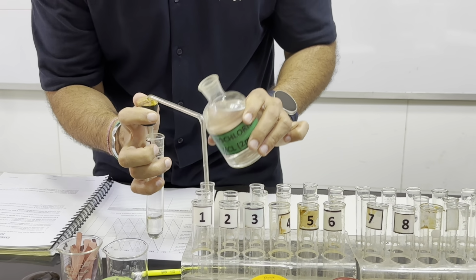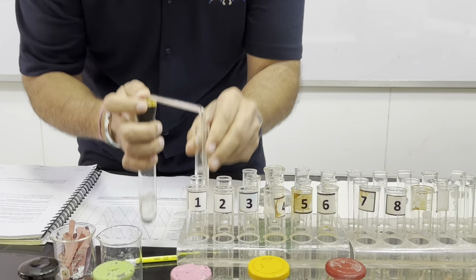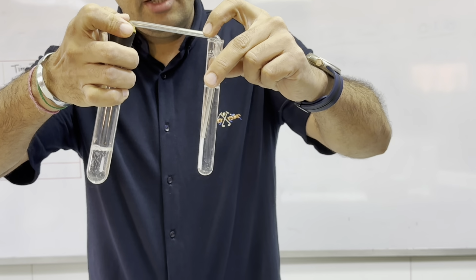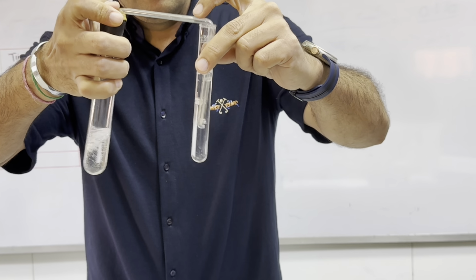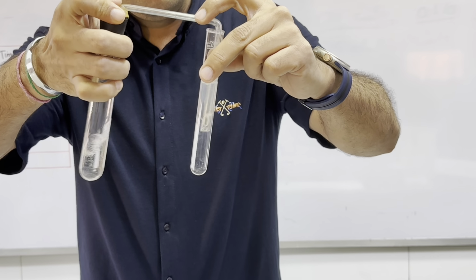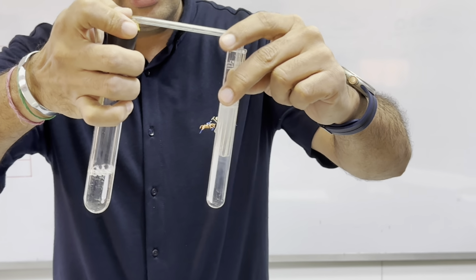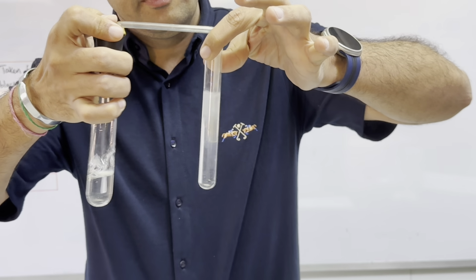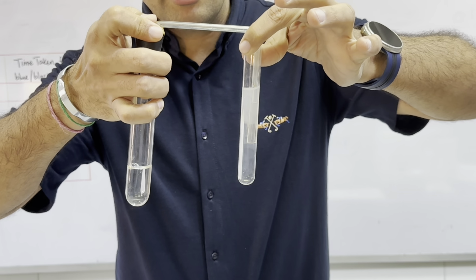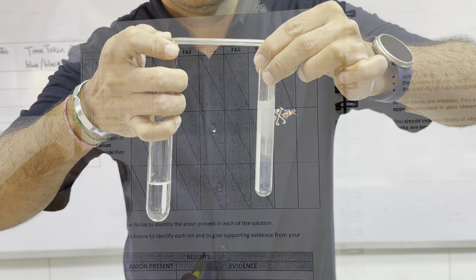So we have this acid being added to the tube, and we will quickly put this so that the gas given off must come to the other tube, and we can see that the solution is giving off a gas which is transferred to the other tube, and the content of the tube you can see is gradually turning white. It means the gas which was given off was carbon dioxide, and it shows that Fa1 contains carbonate ions.